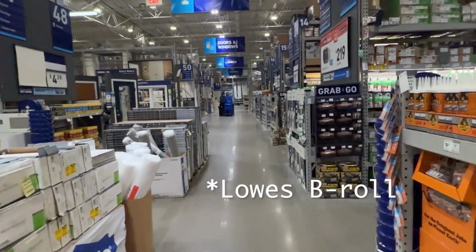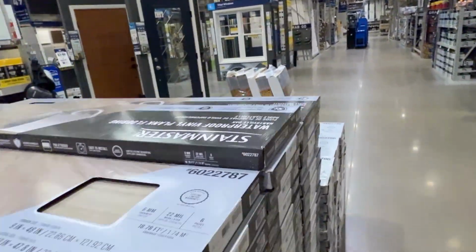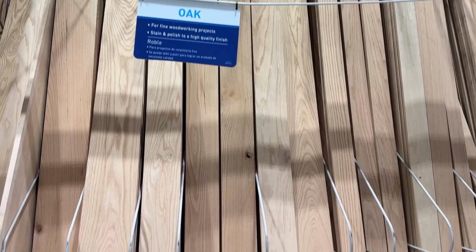So I walked into Home Depot with the near infrared spectrometer and I started scanning all the floors. Now, the staff thought I was crazy, and perhaps I was, but what came from the data was genuinely very interesting and surprising to me.